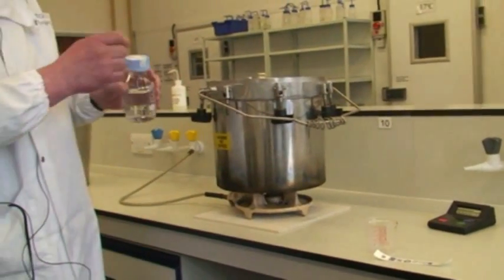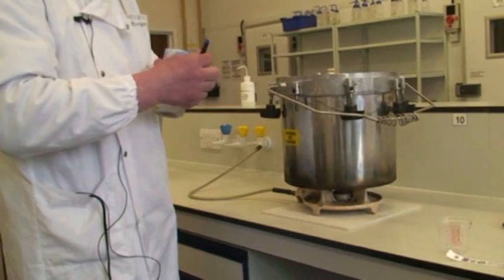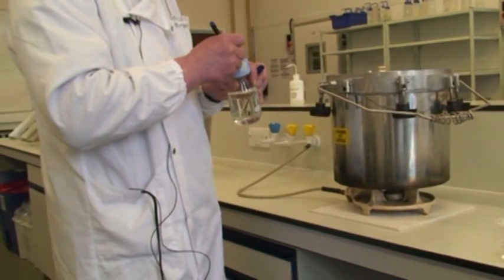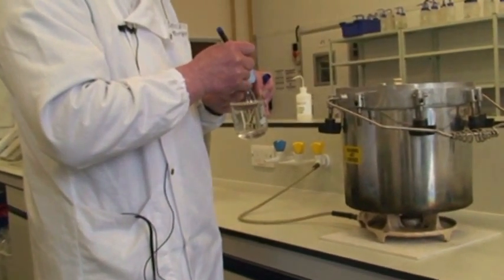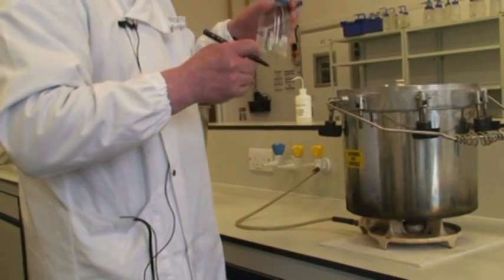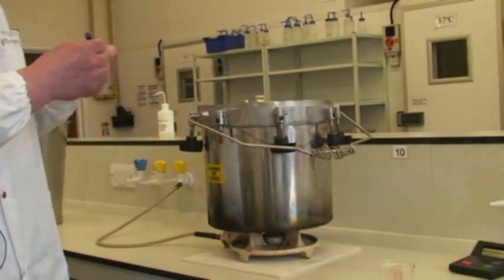Before you start, you need to make sure it's labeled with your name and what it is. Just put my initials on and sterile distilled water, then pop it into the portable autoclave.